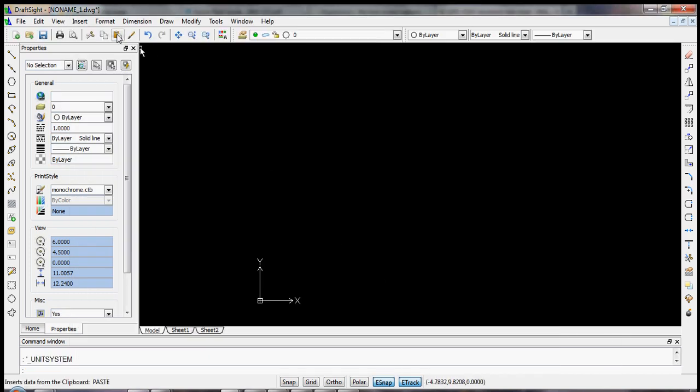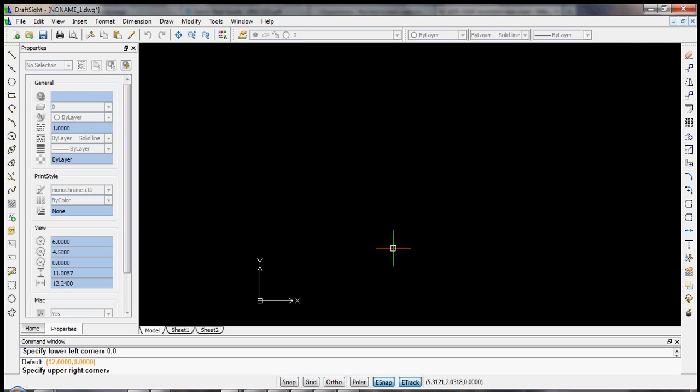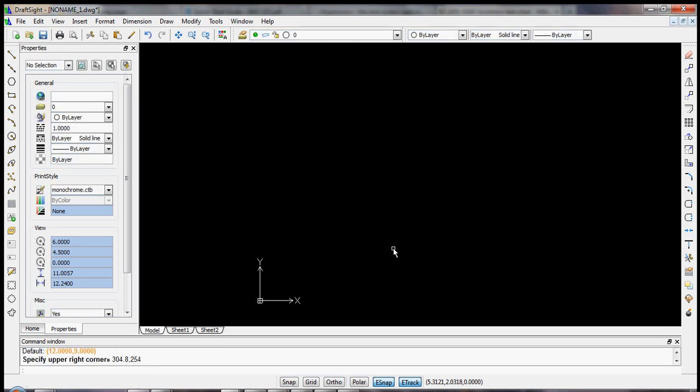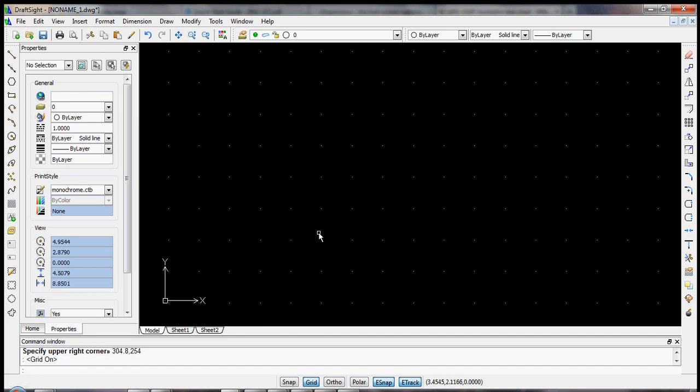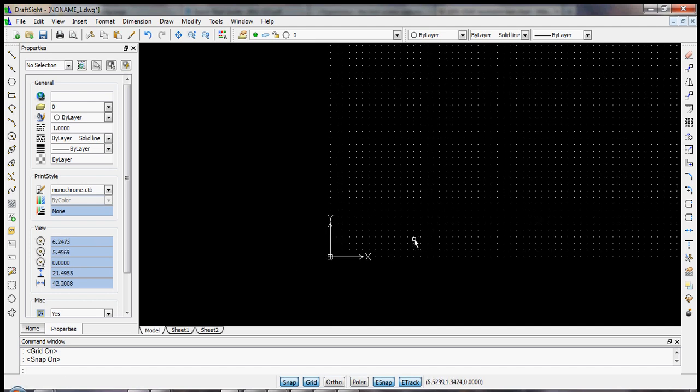apply an OK, and we'll again make a drawing boundary that will be the size of the 10 by 12 inch sheet. In millimeters, that will be a lower left corner of 0, 0, and an upper right corner of 304.8, 254 millimeters. Let's turn our grid on, so we can see again these half millimeter units. We'll snap for the moment.